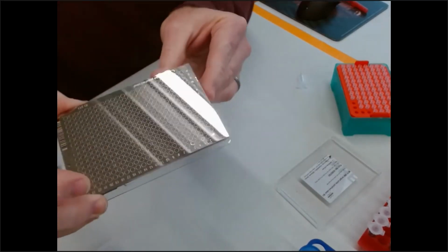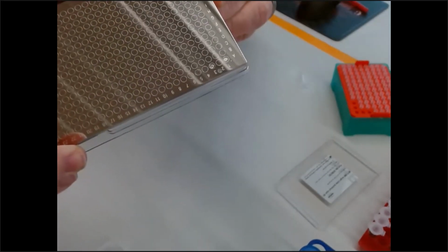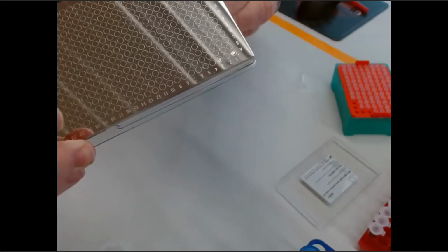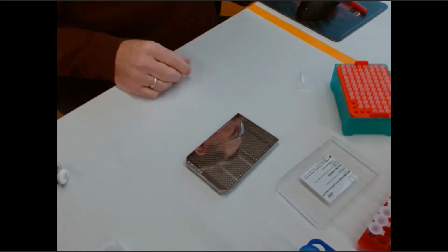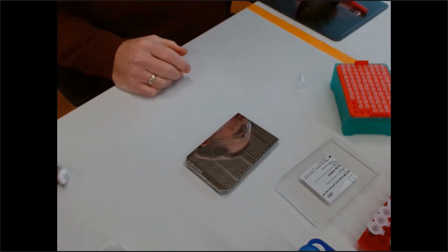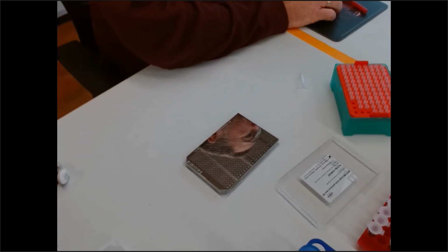I'm going to see if I can bring this up to the camera, but you can see the little wells there, and A1, that sample is already dried. And because it's such a small volume, it evaporates very quickly from the environment. So now I'm going to move away from this demonstration and back to a shared screen. And I will show how we're going to acquire the data from the MALDI instrument.